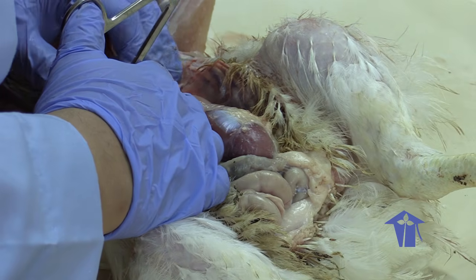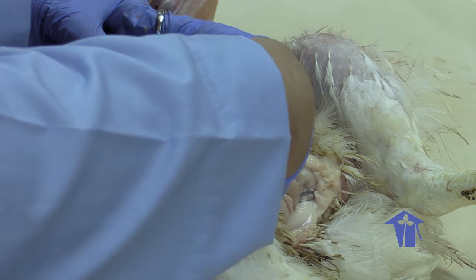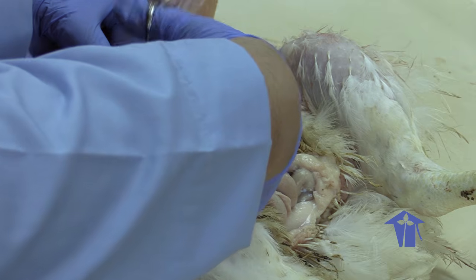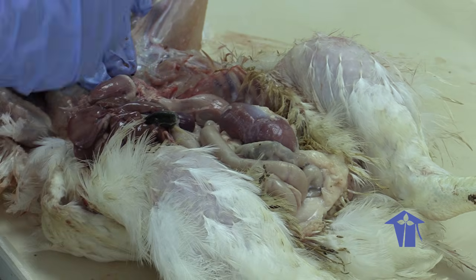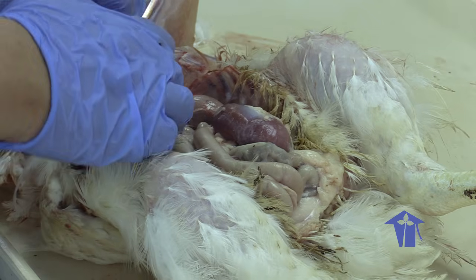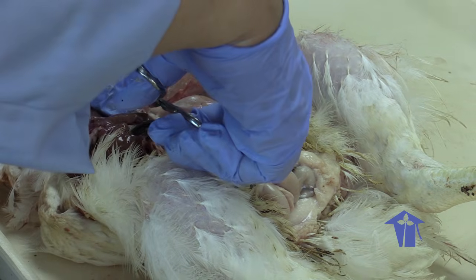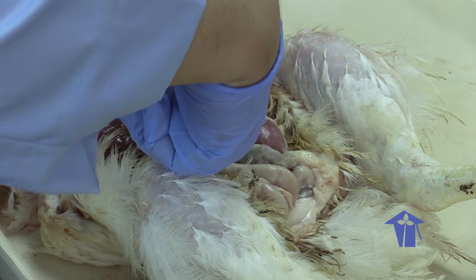So if I were doing dissections every week, it's not going to bother me because I would just develop the mental space where whatevs, it's just one more thing I acclimate myself to. However, this is the first dissection I'm doing in a long time, so the smell is going to get to me a little.